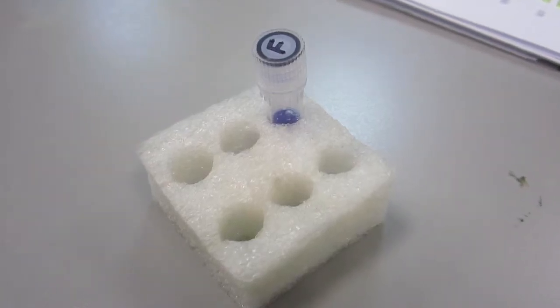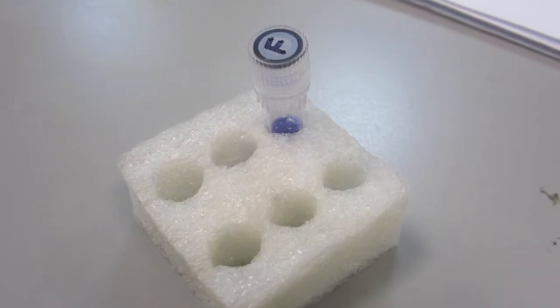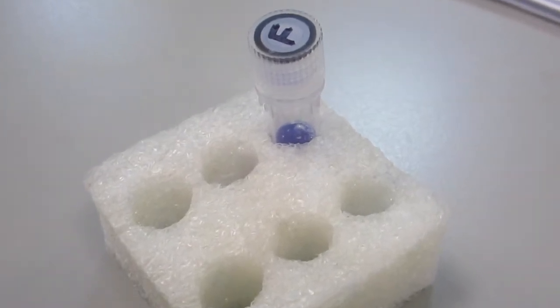Step 4: Incubate the fish samples for 5 minutes at room temperature to extract and solubilize the proteins.